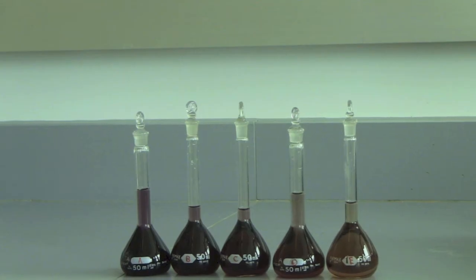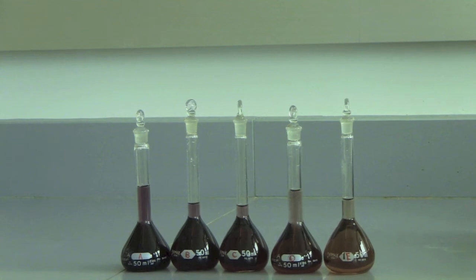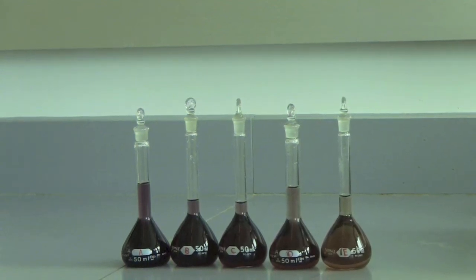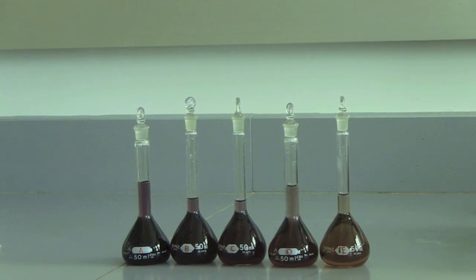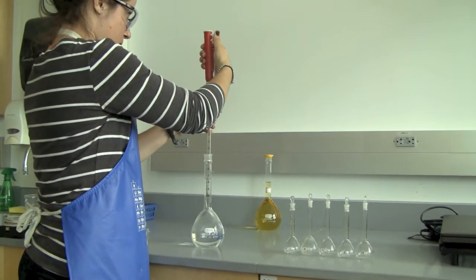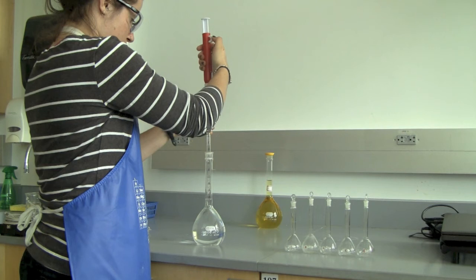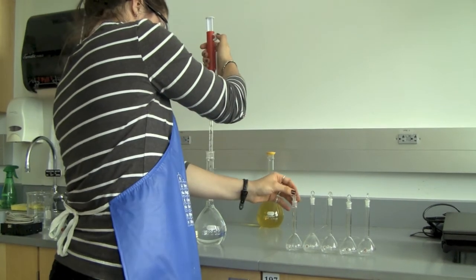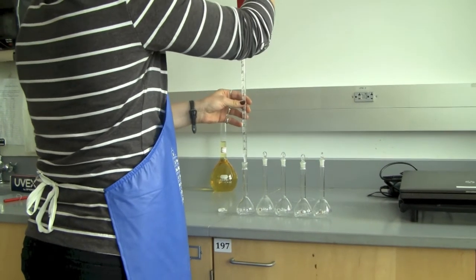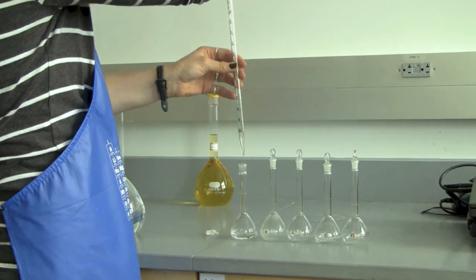To form the standard curve for this experiment, you will need to make several different concentrations of the iron 3 salicylate complex solution. You will measure the absorbance of these solutions with the spectrometer. To make these solutions, you must use a graduated pipette to measure and transfer the different volumes of the stock solution that you will need into a 50 milliliter volumetric flask. You must be as accurate as possible, because losing some of the solution will affect your calculations for this experiment.